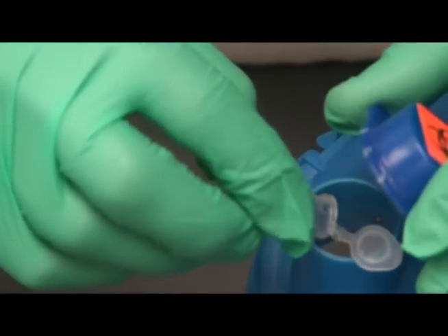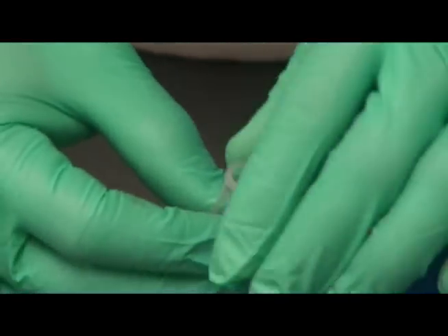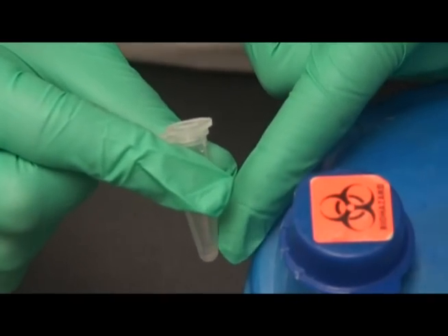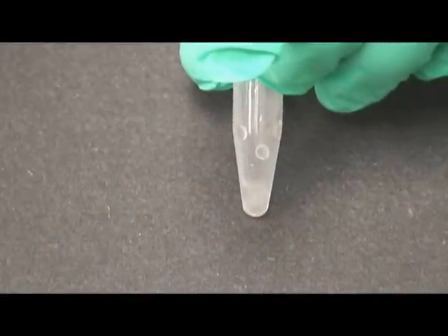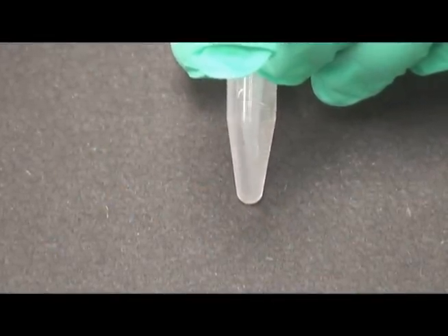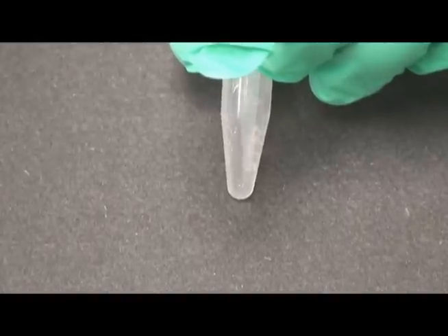Carefully pour off the supernatant into a biohazard waste bucket taking care not to pour off the pellet in the process. The pellet can then be resuspended with 0.75 mL of calcium chloride by repeatedly flushing up and down the tube as shown. The cells are now fragile, so avoid vortexing them.